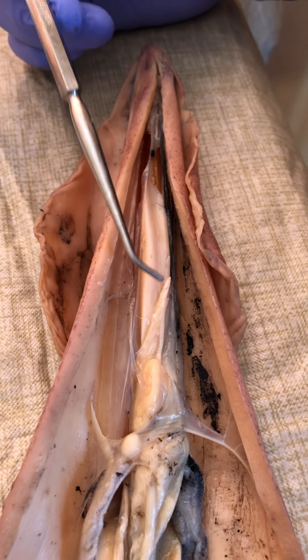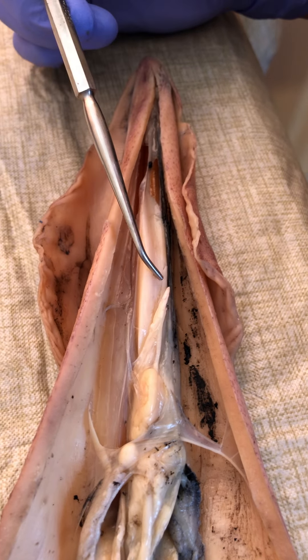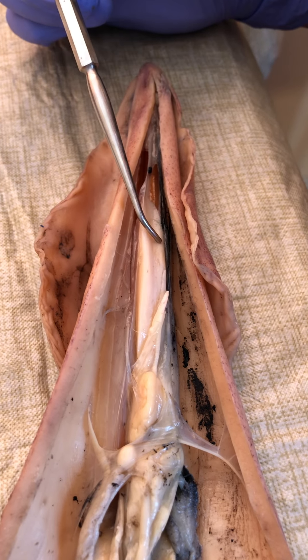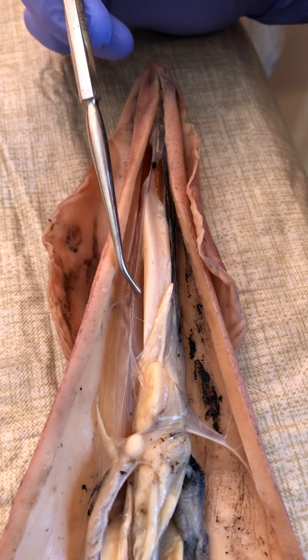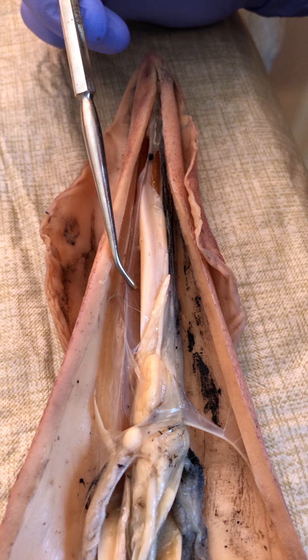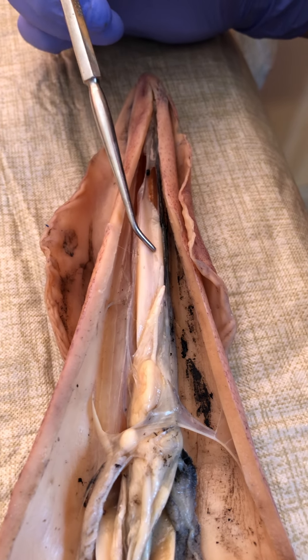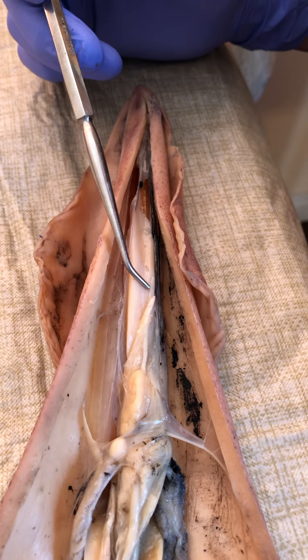One of them is not so much about variation between individuals, it is between the genders. With the female, the ovary was so big you really couldn't see the cecum, kind of lying on top of the pen. So the pen's right here, you can tell it's pretty flexible. And then here is the cecum — I'm calling it the cecum, but I think on your assignment it's called a liver — it's a digestive gland.